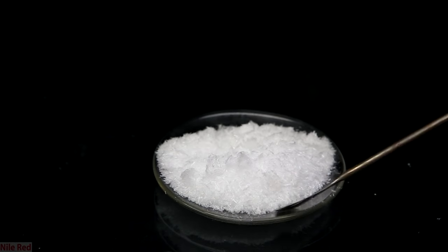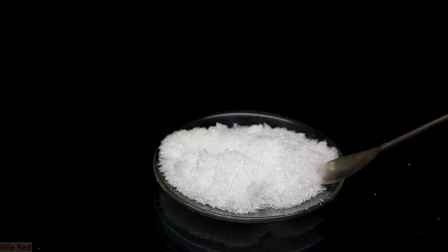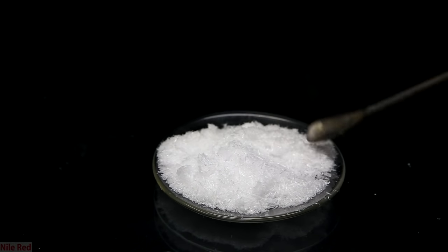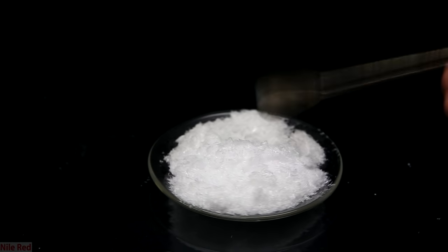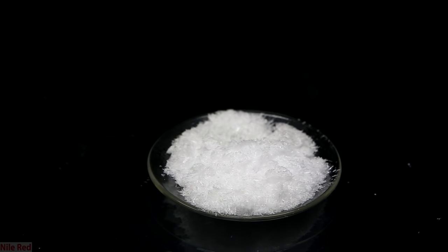I transferred some to a small watch glass so you can see the texture of the crystals easier. You can see here that we're left with some nice clean urea crystals and I'm very happy with the results. One important thing to note is that no matter how good your recrystallization technique is, you will always lose some product in the solvent. It's not uncommon to lose up to 5 or 10% of your product.